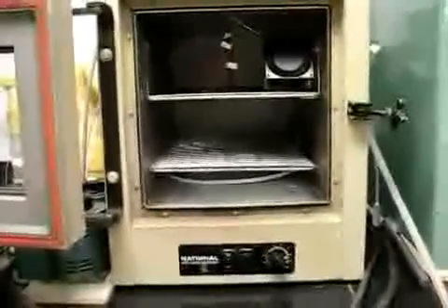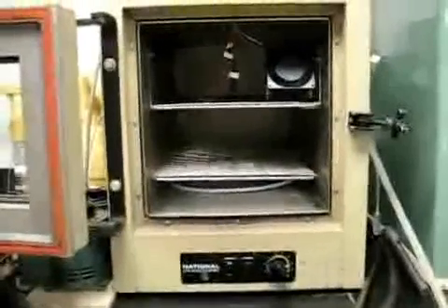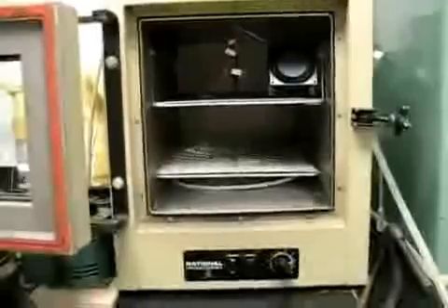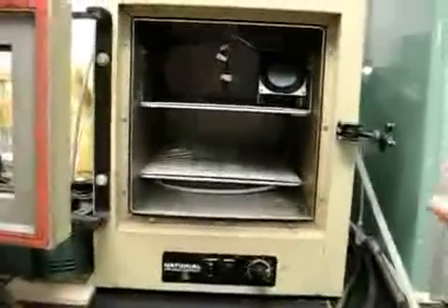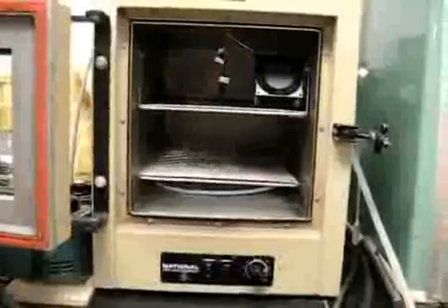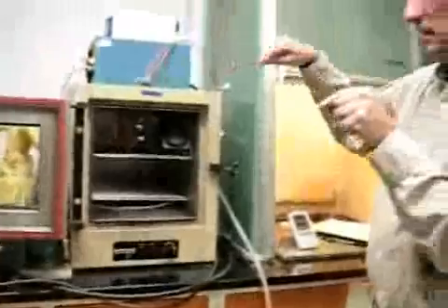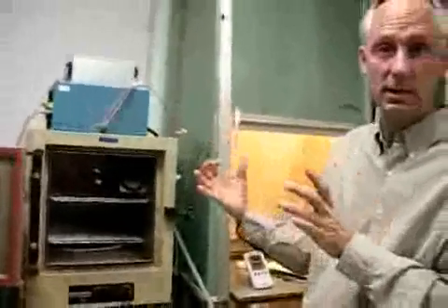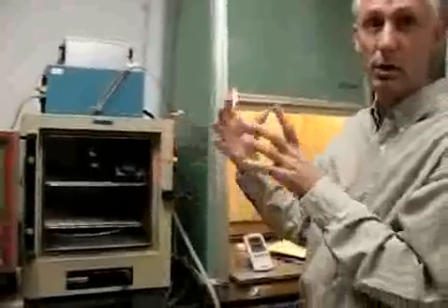We've designed an arrangement of the samples where we have the 4 different types: the untreated sand, the treated sand, an empty bottle, and an empty bottle with the treatment in it. And those are going to be staggered and alternated throughout the oven. So if there is any variability across the oven, we hope to see that.